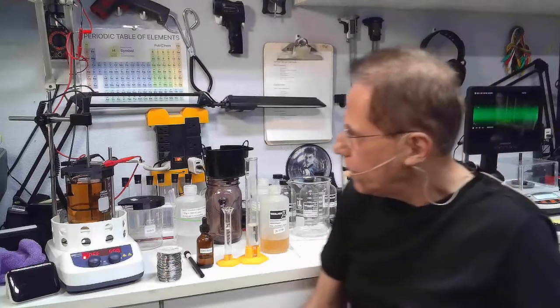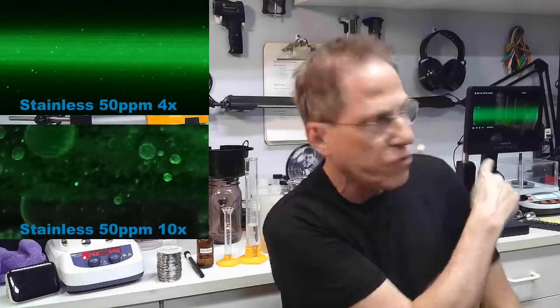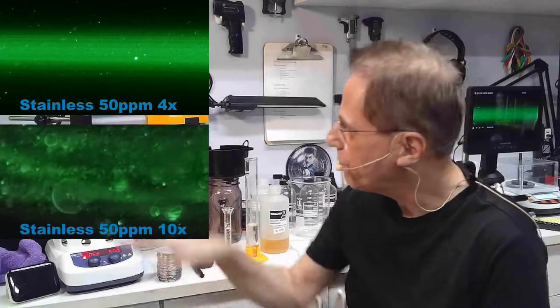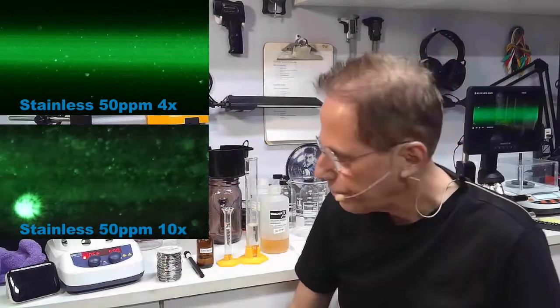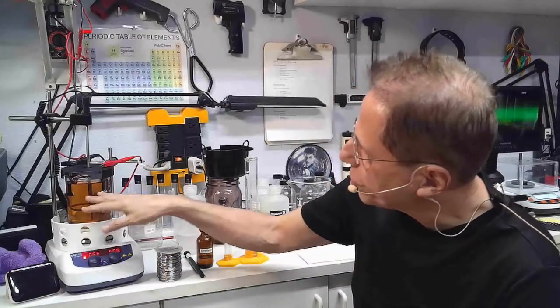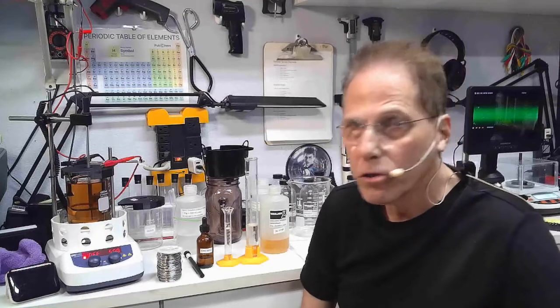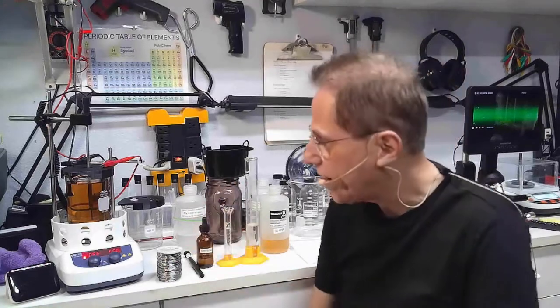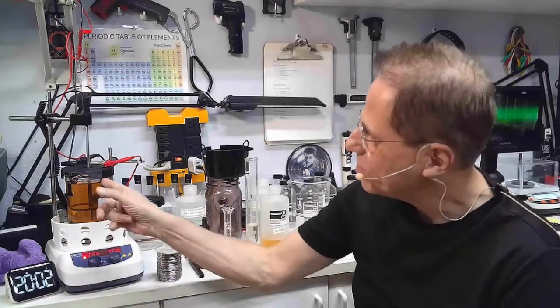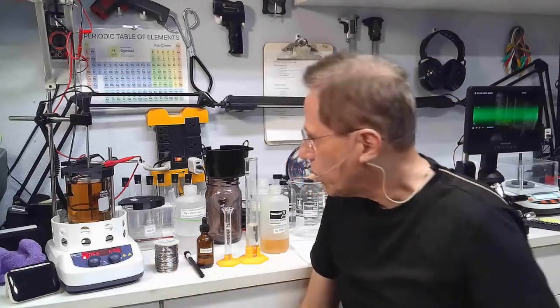That's an amalgam, and that gives us the picture you see — the finished product, which is this dark rich amber color. Most of it is iron, as you can see. If you've been following me for a long time, you're going to like this one because it cooks fast. Want to know how fast? 20 minutes — this dark amber color was reached in just 20 minutes.